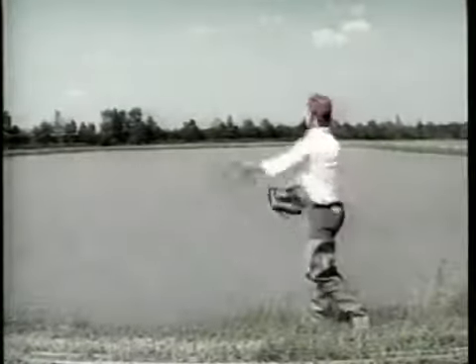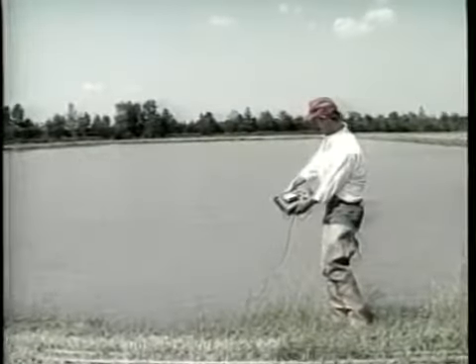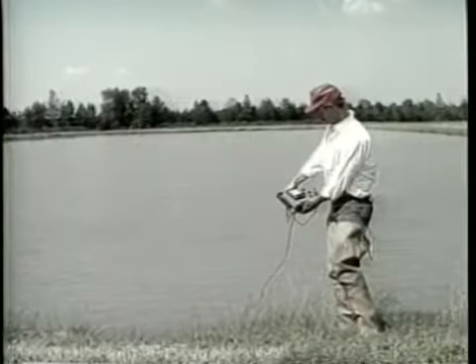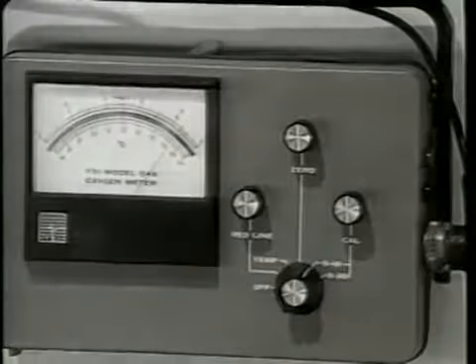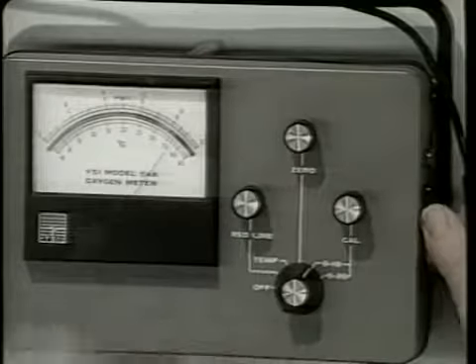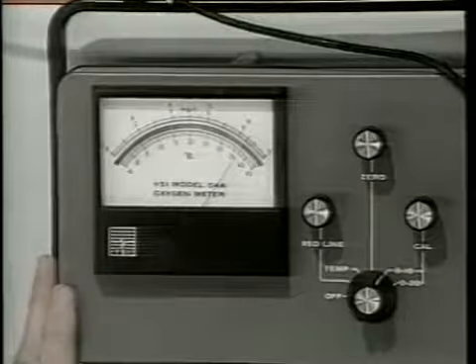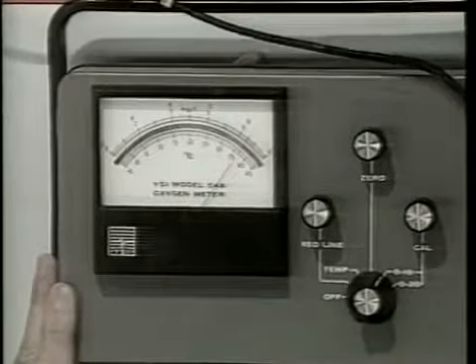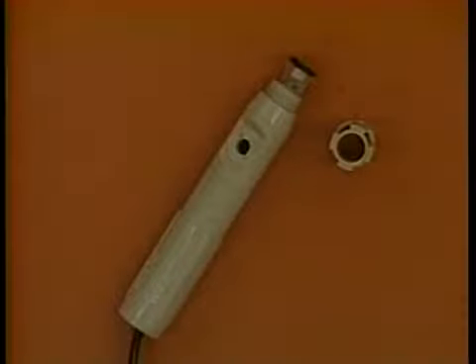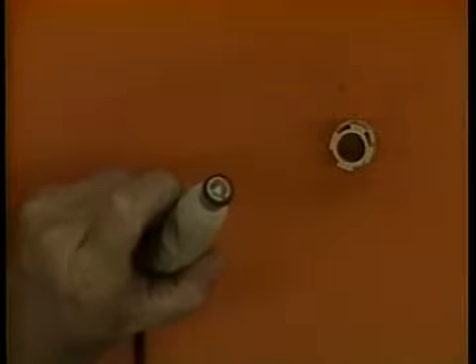It is also unwise to simply throw the probe out into the pond, since the probe and cable may be damaged and the probe will sink into the mud. If properly used and cared for, your oxygen meter may be used for many years with little maintenance. Besides changing and recharging the batteries, the only part of the instrument that requires periodic care is the probe. The oxygen probe is covered by a thin membrane which should be replaced every 2 months or so, or when air bubbles are present below the membrane.